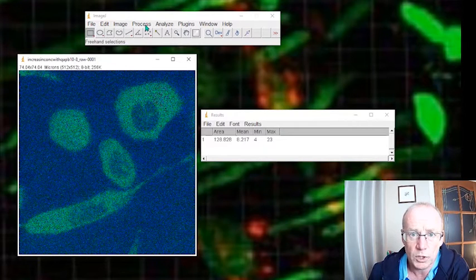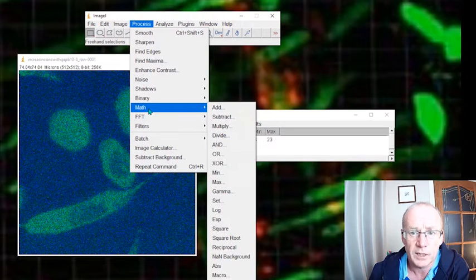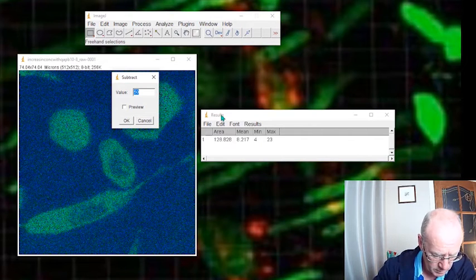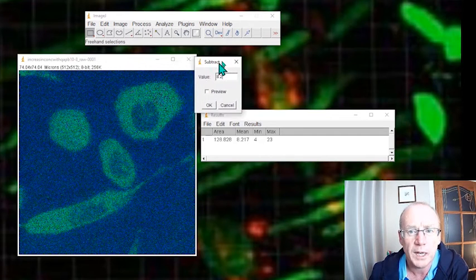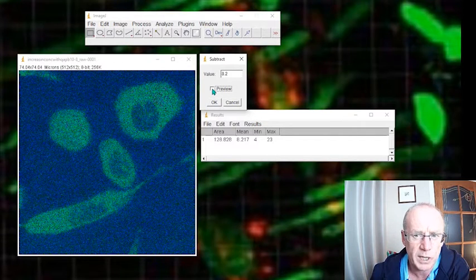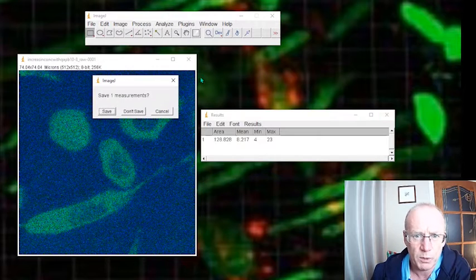I will just go to Process, and for this I want to subtract a value of 8.2. I won't actually do it, I'll just preview it. I think it's quite a nice result. Before background subtraction, after background subtraction, and you just click OK and you would have your subtracted image. How else might we do it?